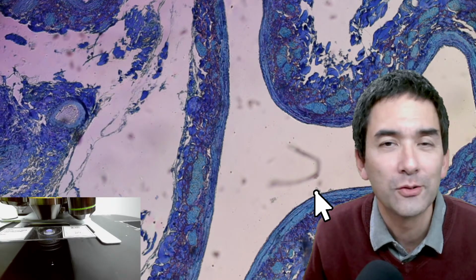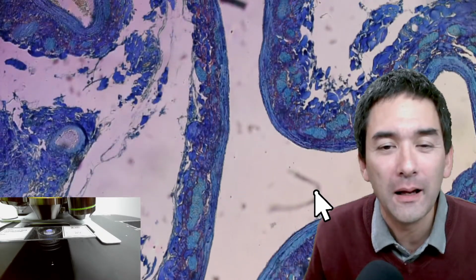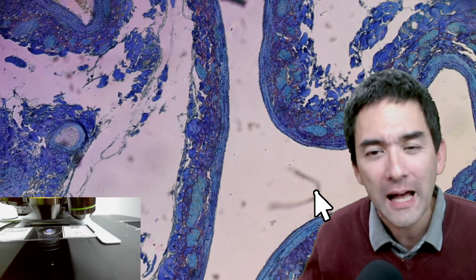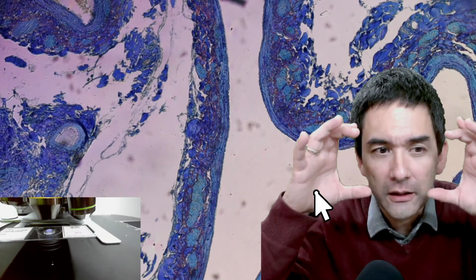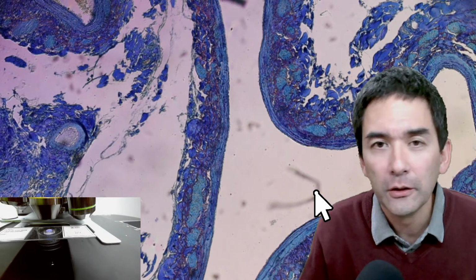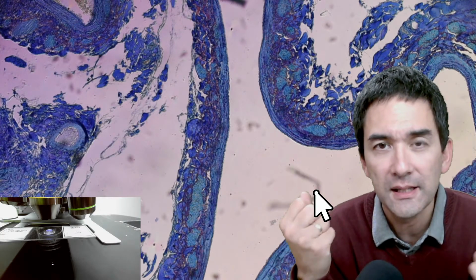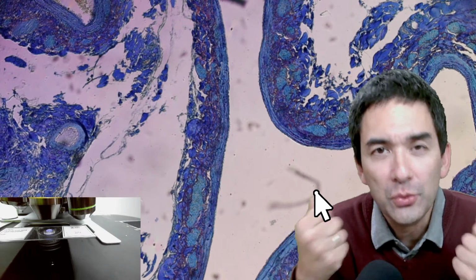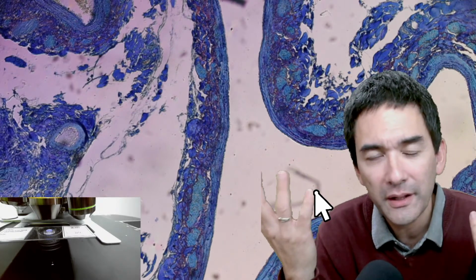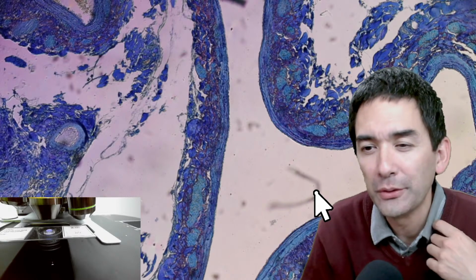Oh, it's great. The previous Olympus was already good. I would say the following. It's not so much the optical quality alone, because if there's a bit of chromatic aberration, okay, who cares? But what is really nice when you look through it is that you have a really large field of view. The large field of view makes it more immersive, so the subjective impression that you get is better. But that's a question of the eyepieces. And in that sense, I like it a lot.